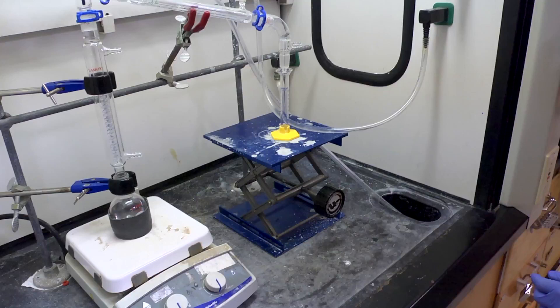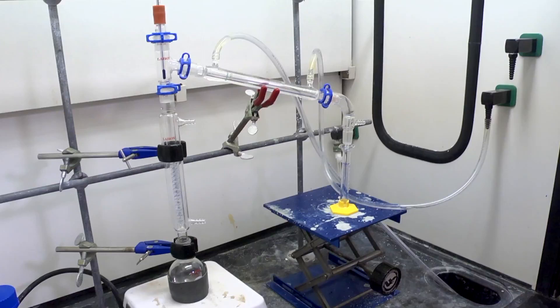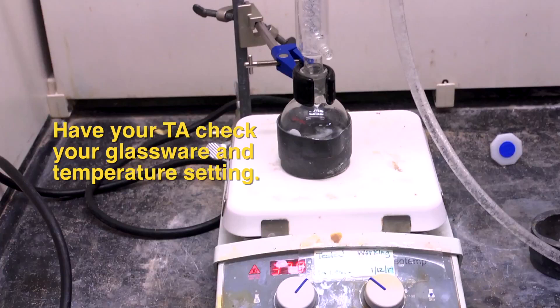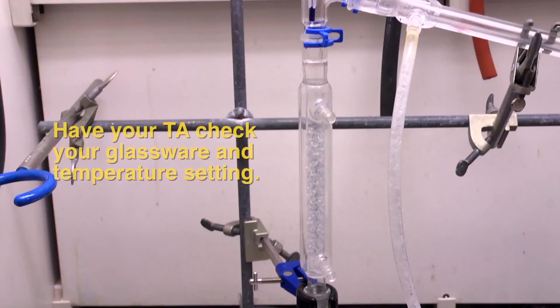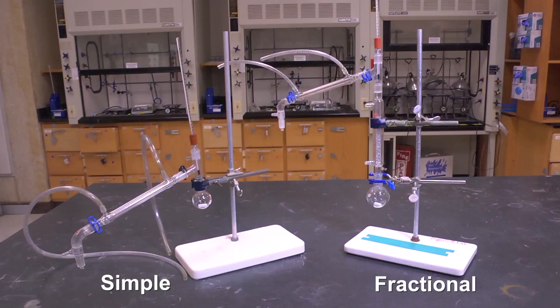Turn the water on. Have your TA check your glassware before proceeding. Your TA will give you the appropriate temperature setting. Now that you've assembled your glassware, let's talk about the benefits and purposes of both distillation setups.